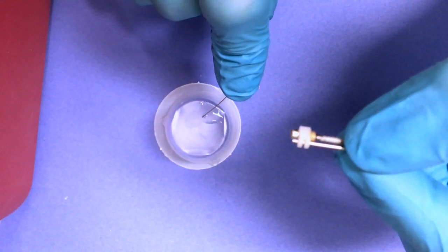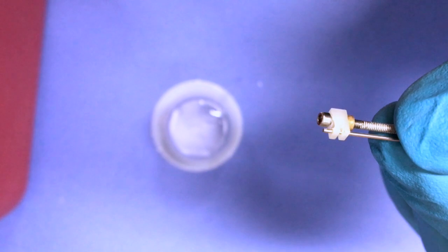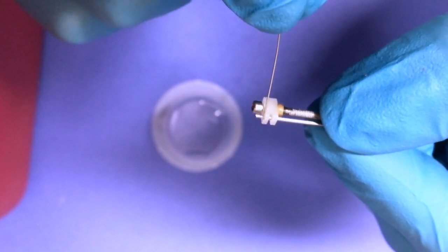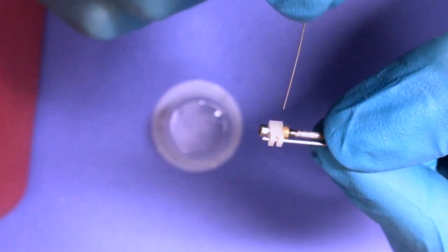For the second stage of gluing, as seen here, you'll want to apply glue in 3 places: at the top of the white box, in the middle, and right below.